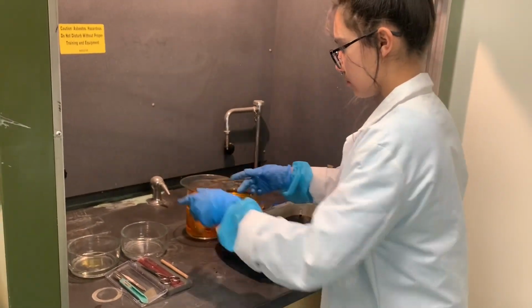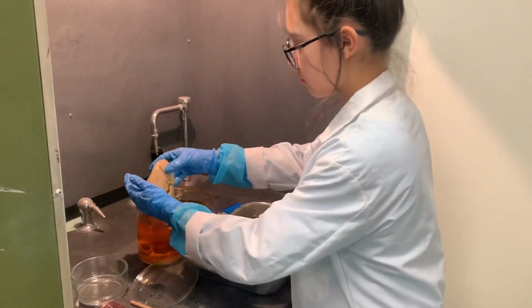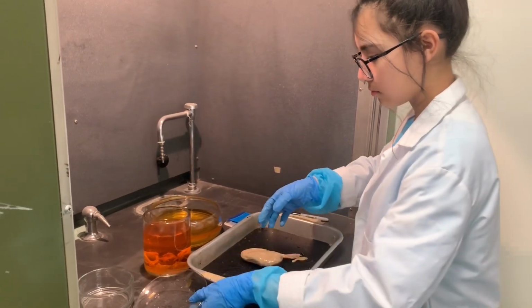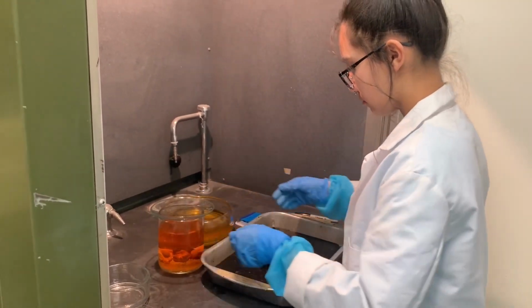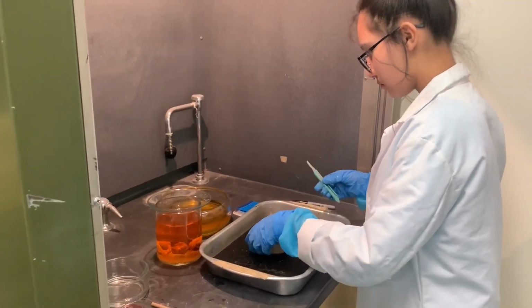After that, I write a label on the container naming the tissue types I have added to it. After the fixation period, which varies from tissue to tissue, I remove the sample from the formalin container and place the kidney on the dissection tray, once again replacing the lid back on the fixative container to avoid unnecessary exposure to the chemicals.